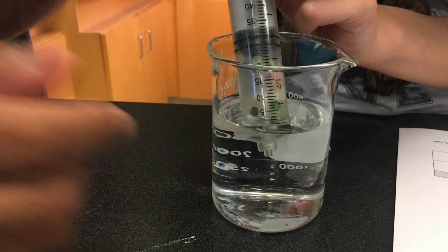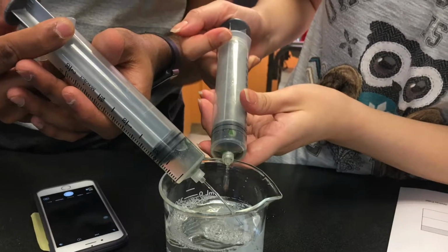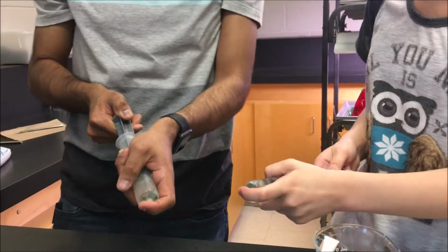Then, repeat steps 1 to 12 again, except this time, instead of topping off the beaker to the 100 milliliter mark with water, top it off with 0.2% bicarbonate solution. After conducting 2 trials with 0.2% bicarbonate solution, repeat steps 1 to 12 once again, except this time top off your beaker with 0.4% bicarbonate solution and record your observations.